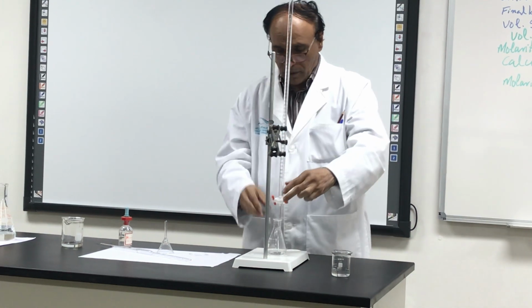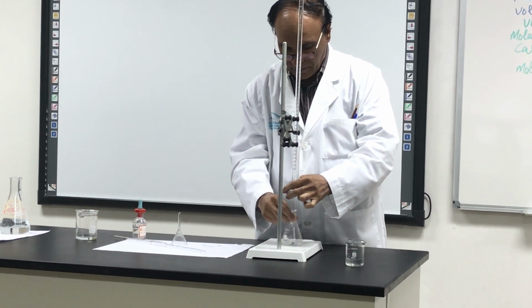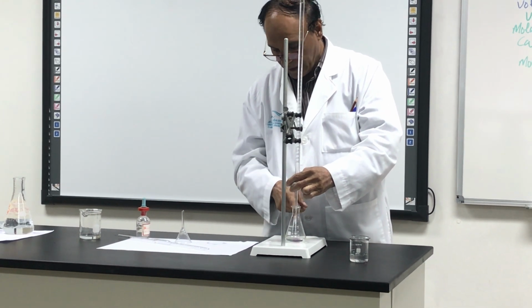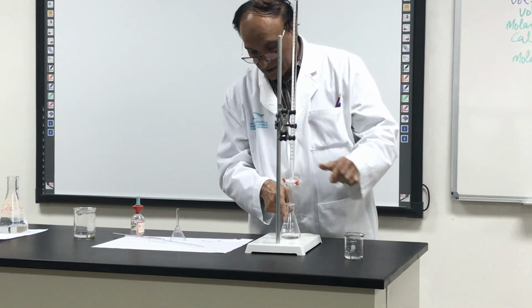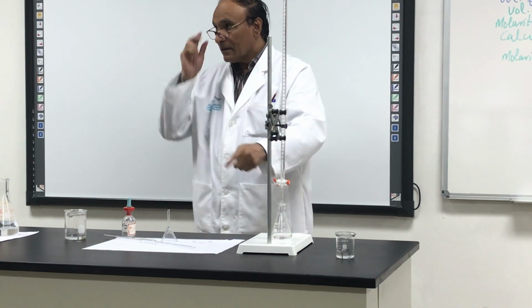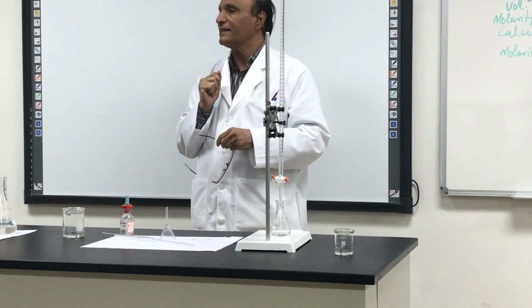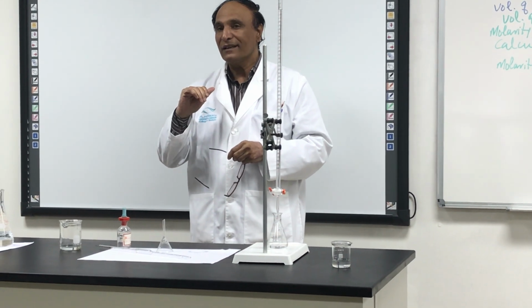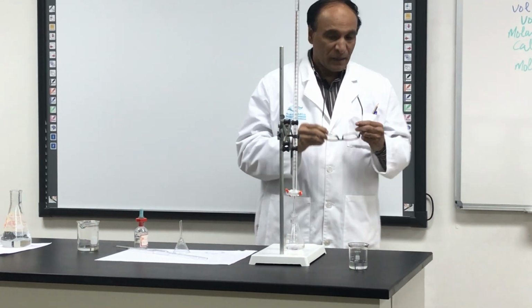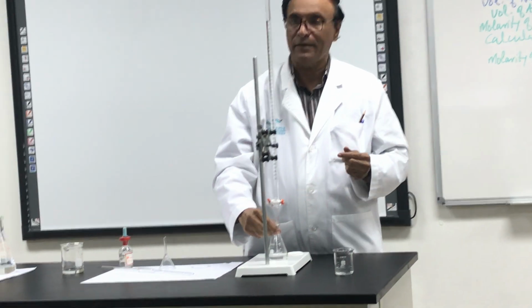And so look over here. We are doing it and we shake it. And when the pink color is coming, you look over here. Now the pink color is still there. Did you see? The pink color is still there. Before it was disappearing quickly. Now the pink color is still there, which means that the end point is near. Okay? Do you understand? Yes. So if I shake it, it will disappear because this is not the end point.